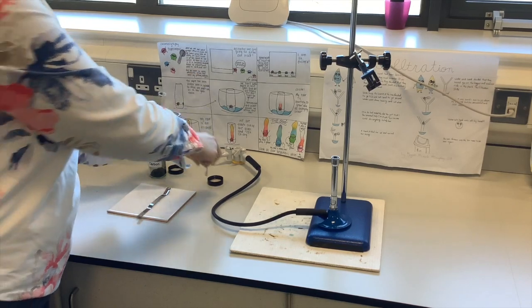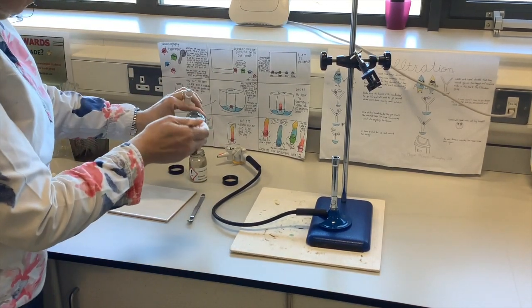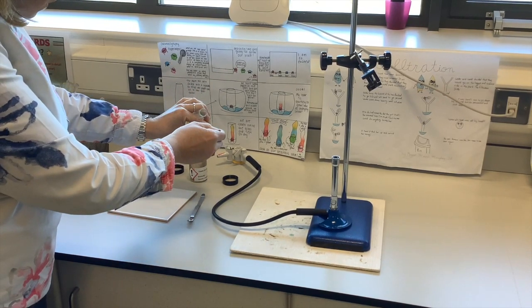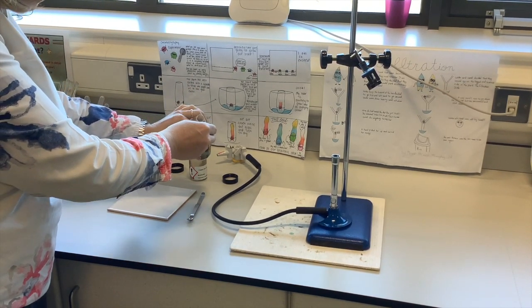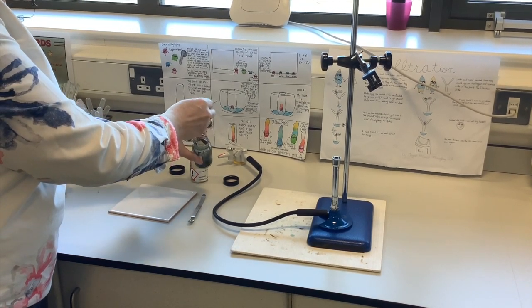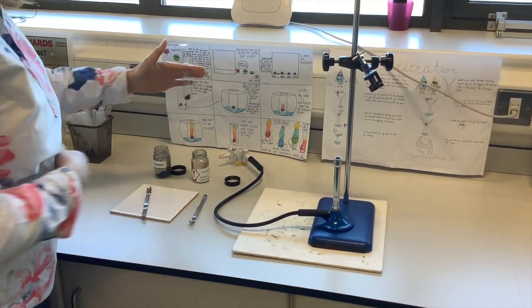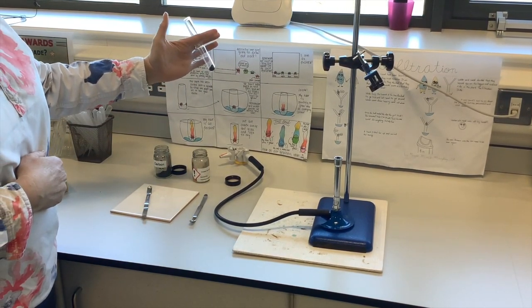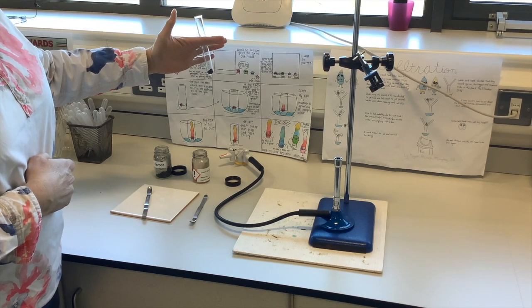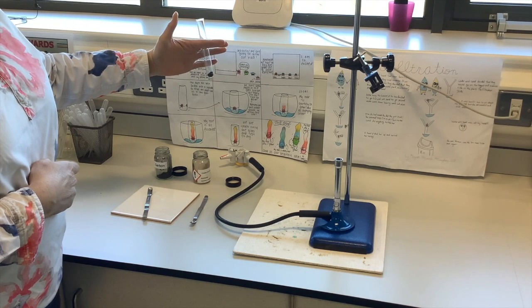And the other chemical that I'm going to put with it is carbon. And so this is actually soot, and this is the element carbon. What we're going to try and do is a little experiment where the carbon steals away the oxygen from the copper. So the copper oxide and the carbon are now in the test tube, and it doesn't look like much, it's black powders. But we're going to heat them, and we're going to see if the copper oxide will lose its oxygen to the carbon.